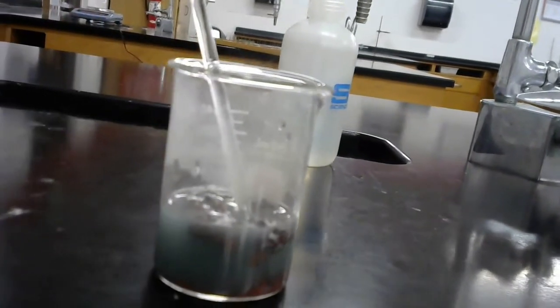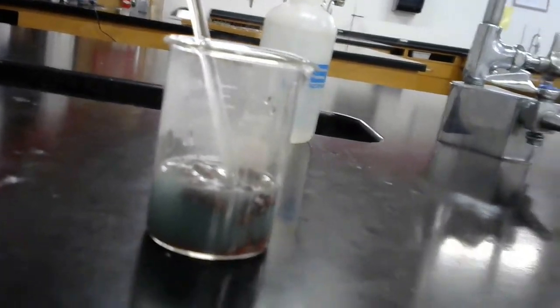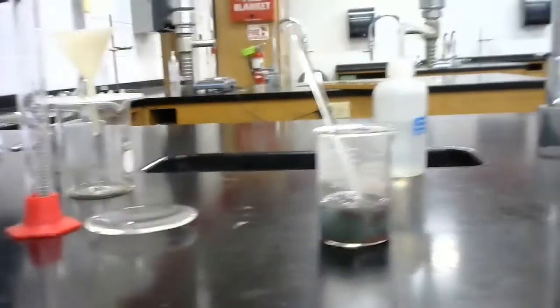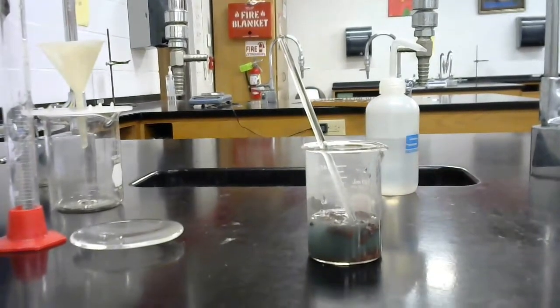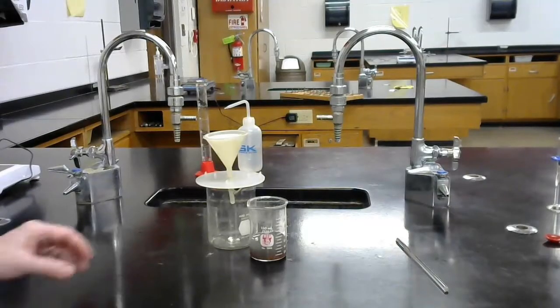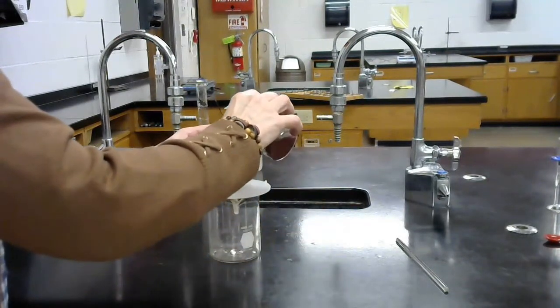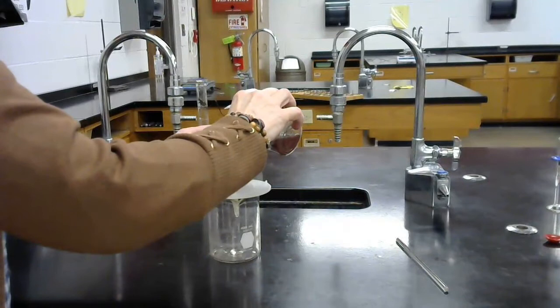So we're going to let that sit and react and check this in just a little bit of time. So for the final part of this lab, it looks like the reaction has gone to completion. We need to filter this.